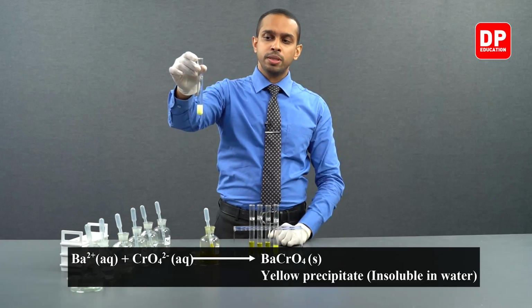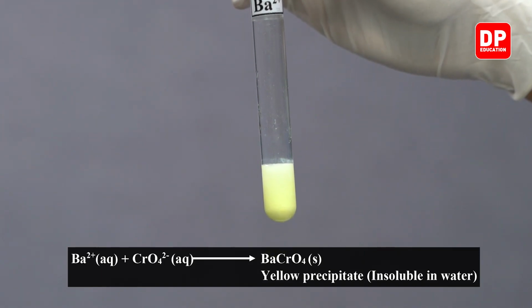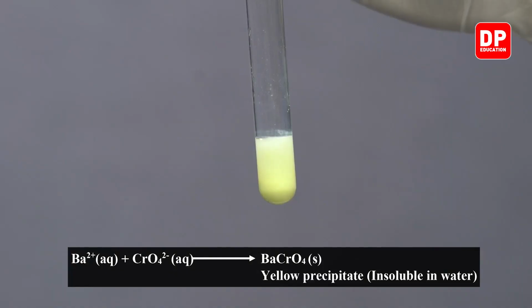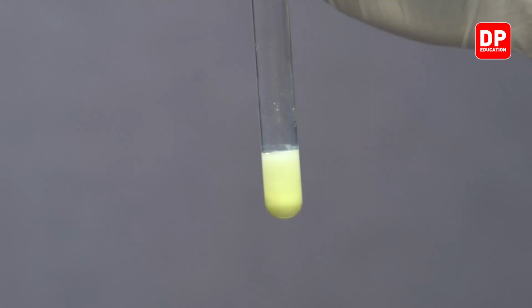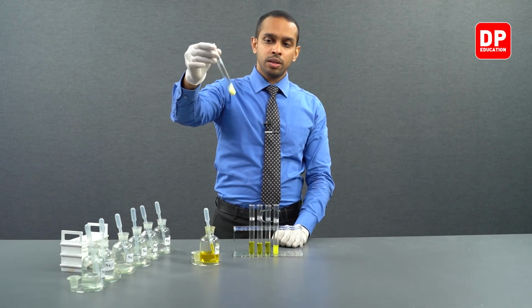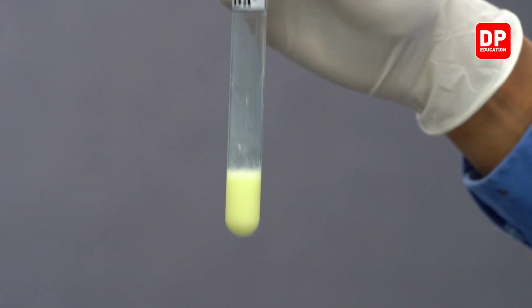Upon adding a few more drops of sodium chromate, we saw that barium ions reacted with the chromate anion to form a yellow color precipitate. A pale yellow color precipitate is formed, and this precipitate is barium chromate. Barium chromate is a yellow color precipitate. Barium ions in the presence of chromate ions form a yellow color precipitate that is insoluble in water.